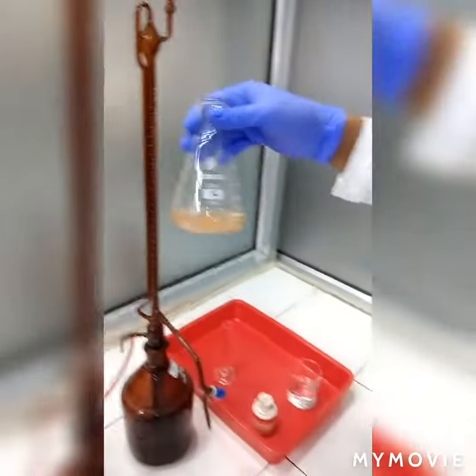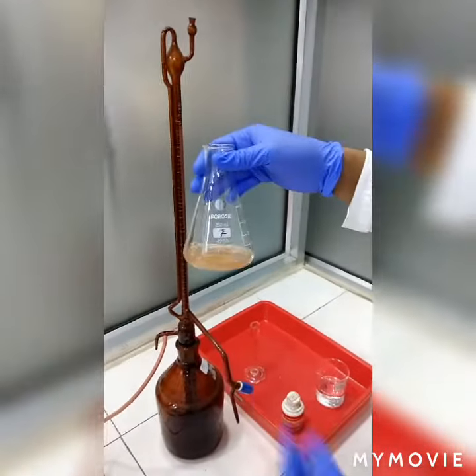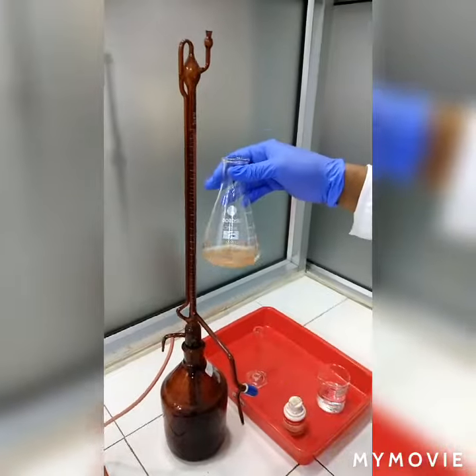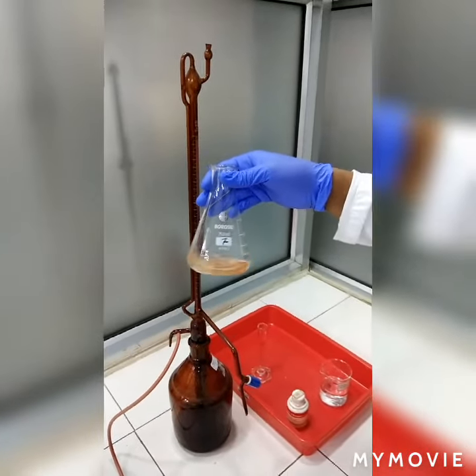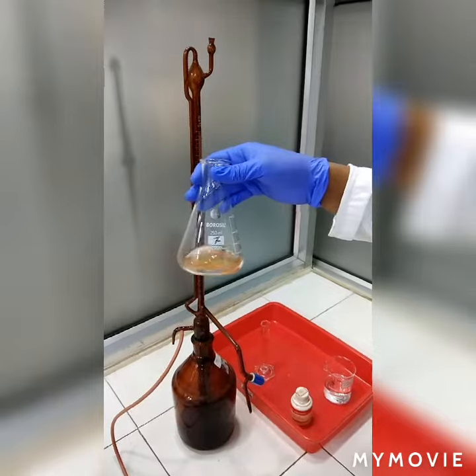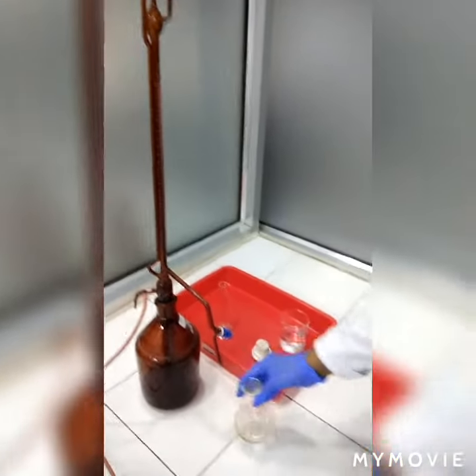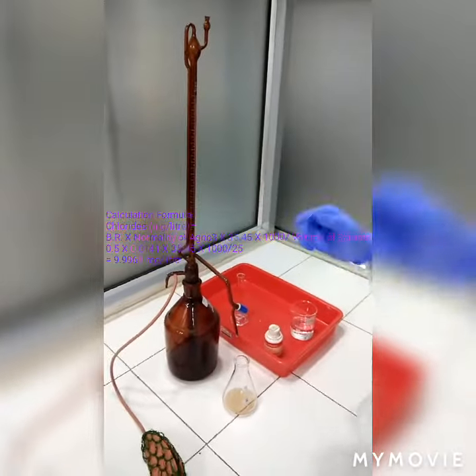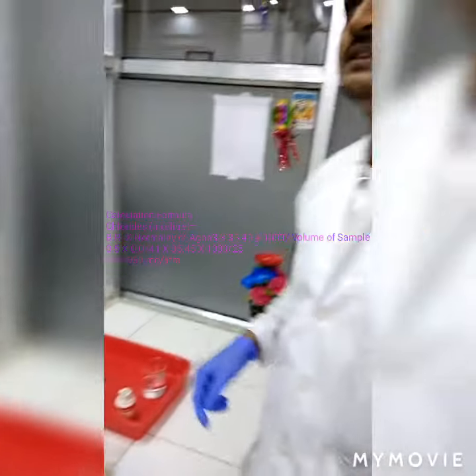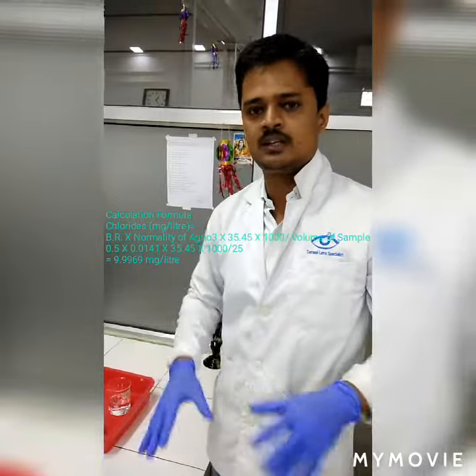This red color indicates that the silver nitrate started reacting with potassium chromate and the content of chloride is over. This burette reading we have to put into the calculation formula. For the detailed explanation, go to the description.